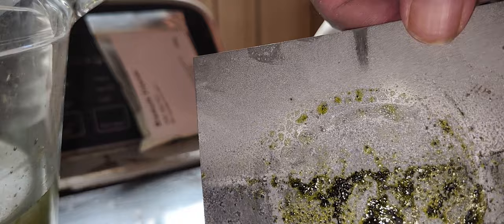This should work for copper and other metals. This is more beautiful because it has a contrast between brass and bismuth which, like this aluminum, you might be able to get this kind of contrast. A greenish color with a Dragendorff reagent, which is absolutely stunning.